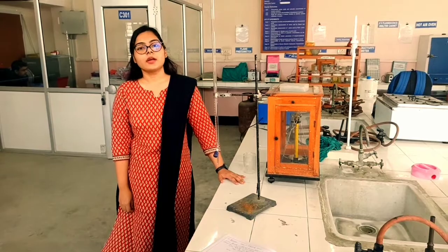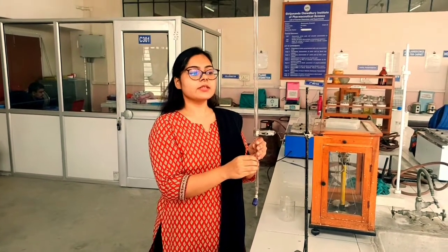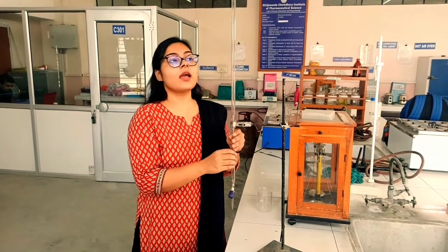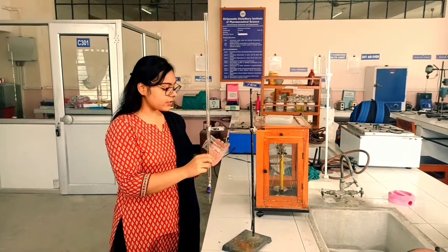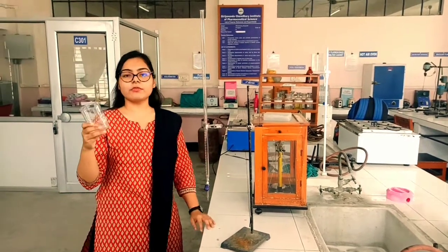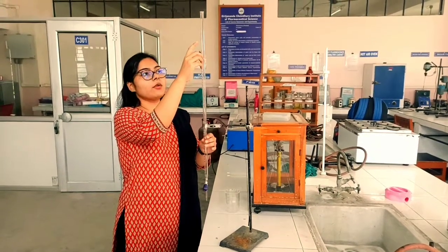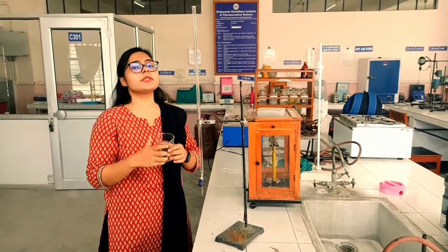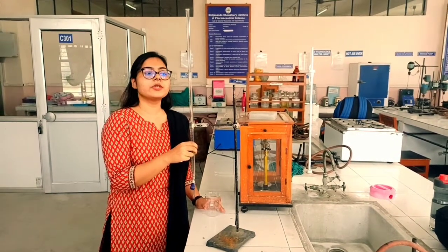Our third apparatus for calibration is a burette of 50 ml volume. In the case of this apparatus as well, we don't have any process to directly weigh how much water it holds. So we will follow the same process as we did for the pipette. We will take the empty weight of the beaker, fill this burette till the 50 ml mark, and then empty the whole thing into the beaker. Then we will take the weight of the beaker once more. This way we will find the amount of error which this burette has.